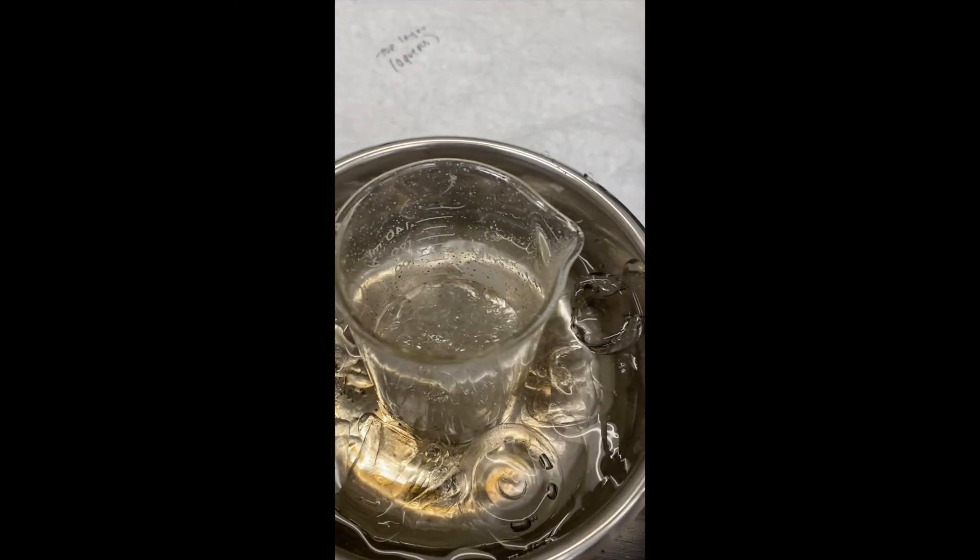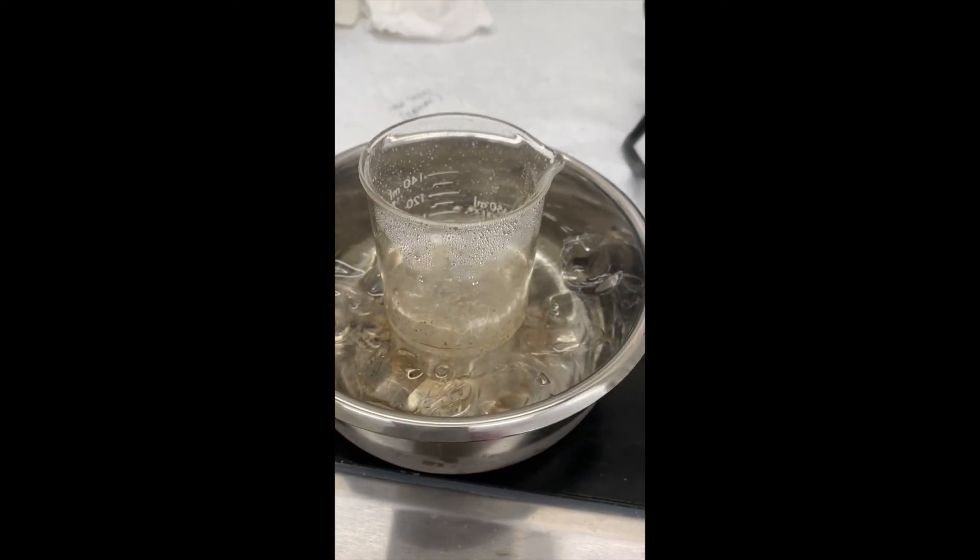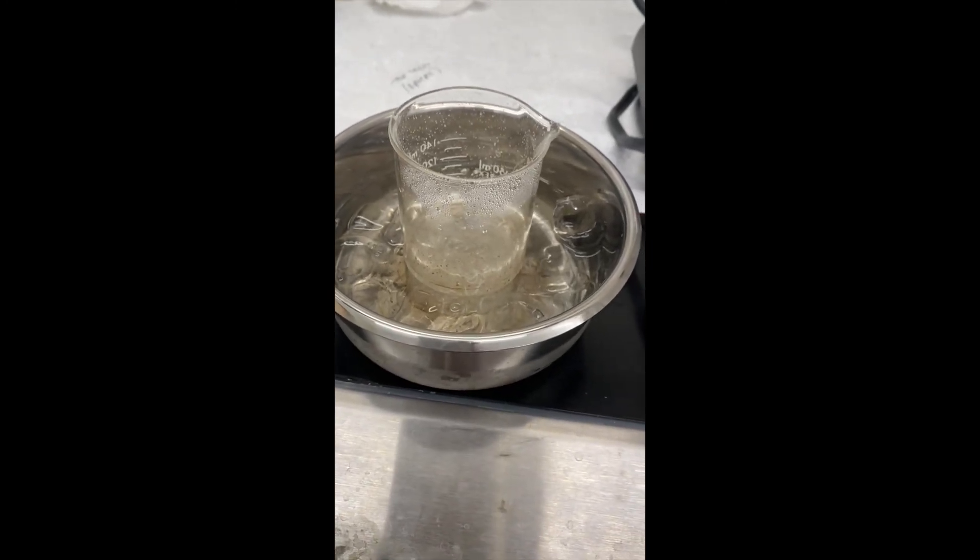Remember, as we decrease the temperature, we're also decreasing the solubility of that solid. So we'll just let this ice for a minute or two and then we'll do a vacuum filtration.